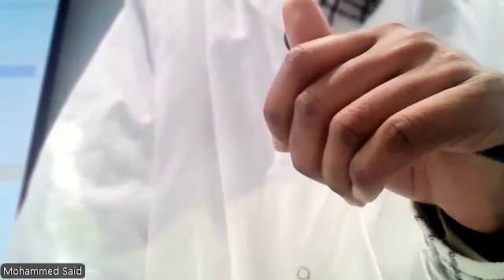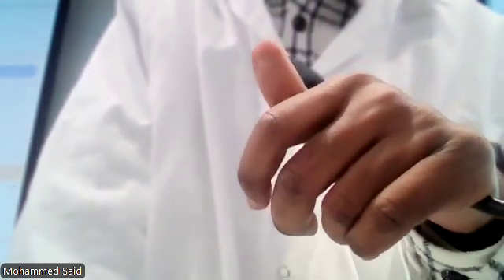You should be able to take it out. Remember aseptic technique, everyone, for conjugation. Also, that you resuspend your bacterium. Group 5, how many more exercises are left? Plaque assay, transformation, and conjugation. Okay, so can one set of you do the conjugation?